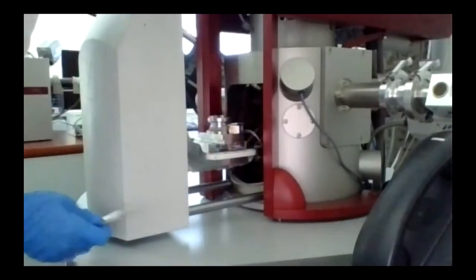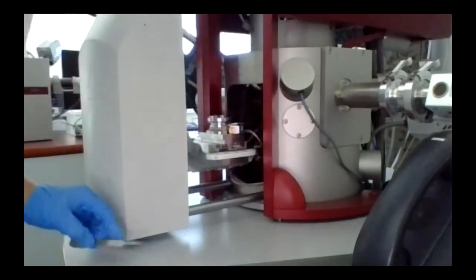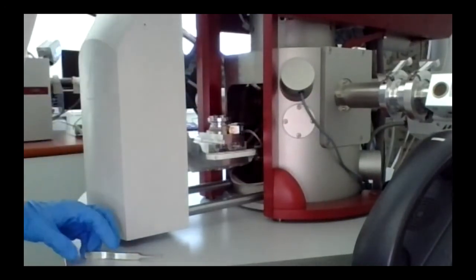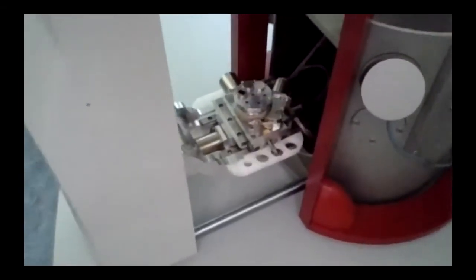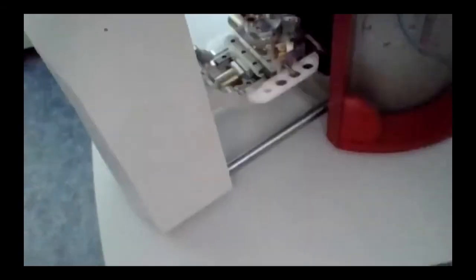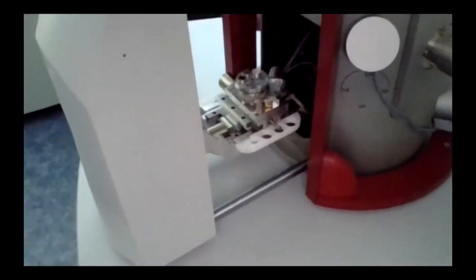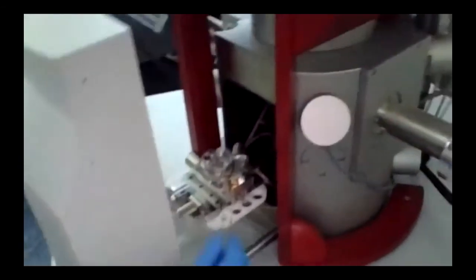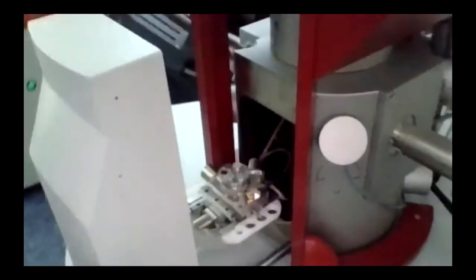You can put, like maybe like that. It's better from the bottom part. Here is a holder. You can put there 7 samples in a row. Better. Like that. I put there already something, but I just will show you how fast it is. So you're taking your pin, placing it there and fixing, that's it.